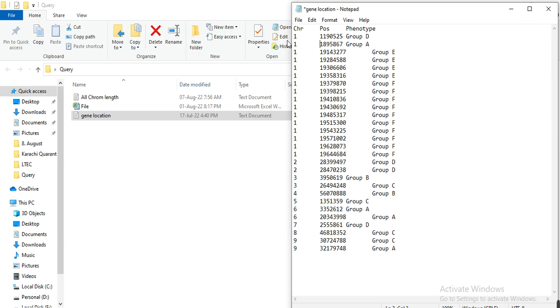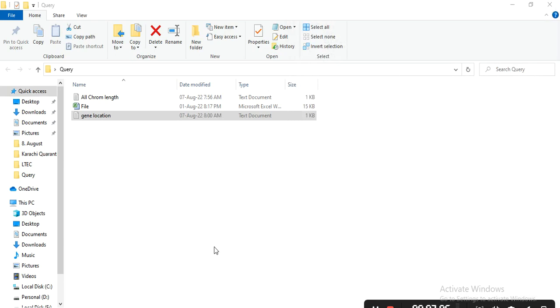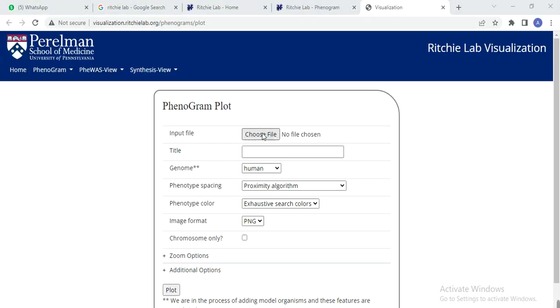So we have removed the space between these two columns and pressed only one tab button. I thought that maybe when you copy these values from your Excel sheet and paste them, you get this type of data, so you want to make them in one line, and that's why this space comes and the software didn't read it. There is no need to arrange them in one line. Keep it as it comes from the Excel sheet and then use this file to generate the phenogram. Now we can save this file and use these two files in Phenogram to construct the gene location. Hopefully the problem will be solved.